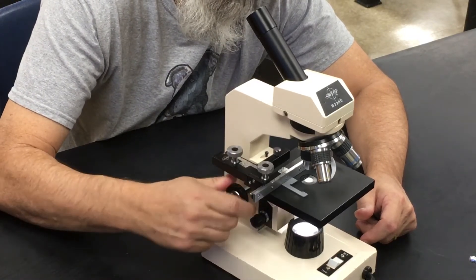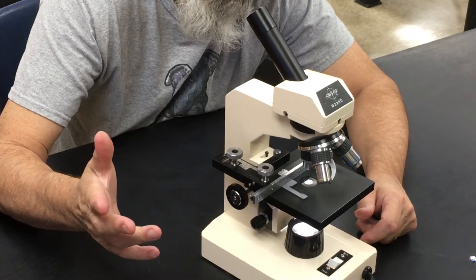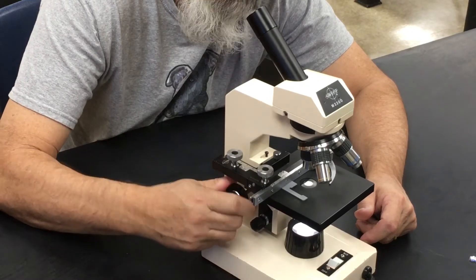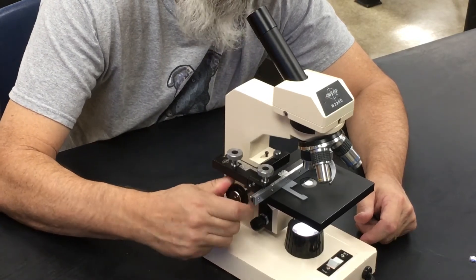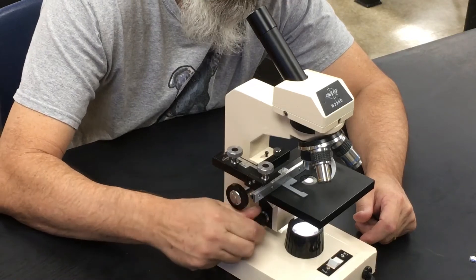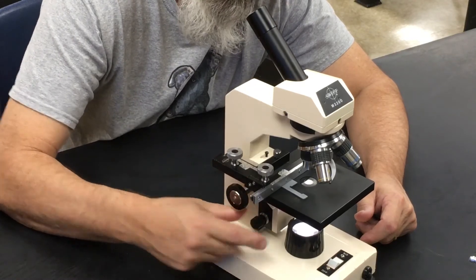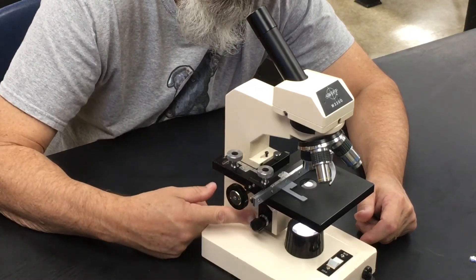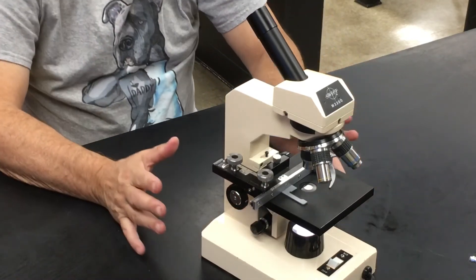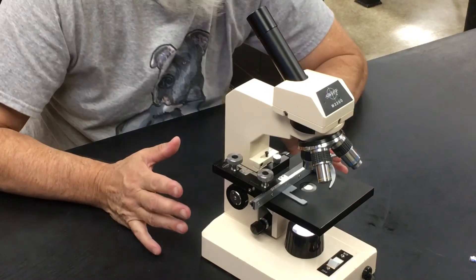This one isn't tensioned properly so the stage is lowering — I need to get this fixed. The coarse focus knob is the large one, and then the fine focus knob is this small one. I think that covers every part.